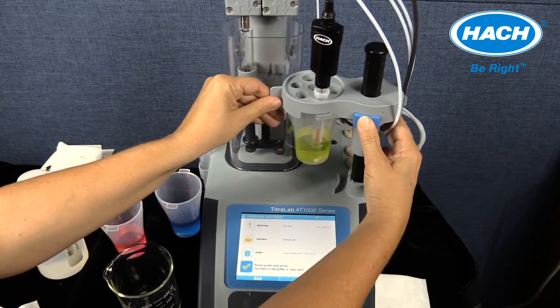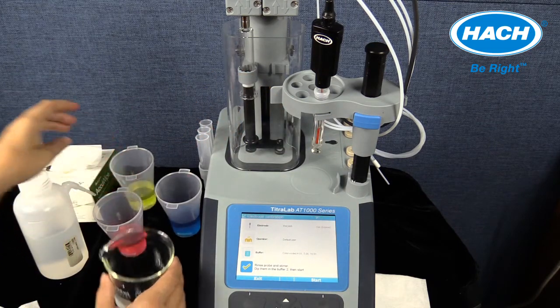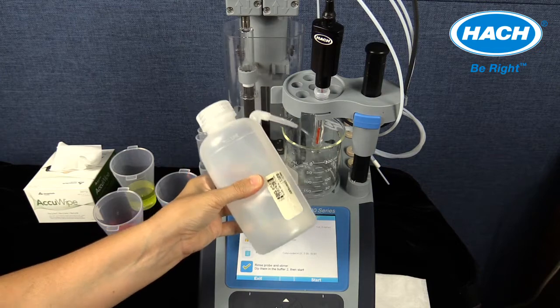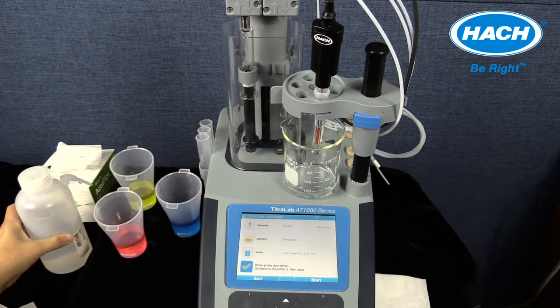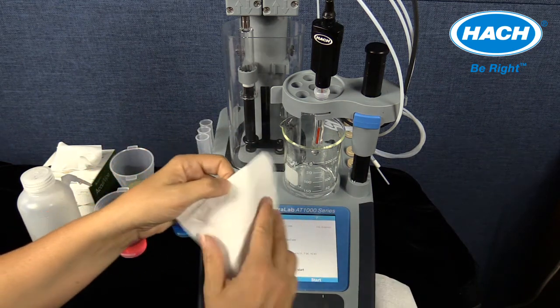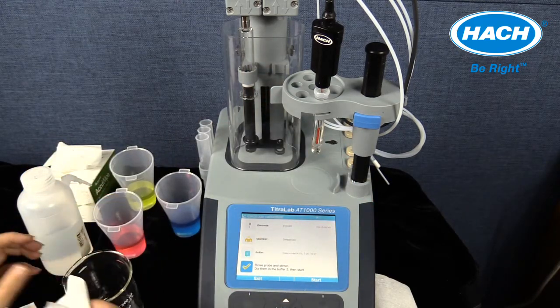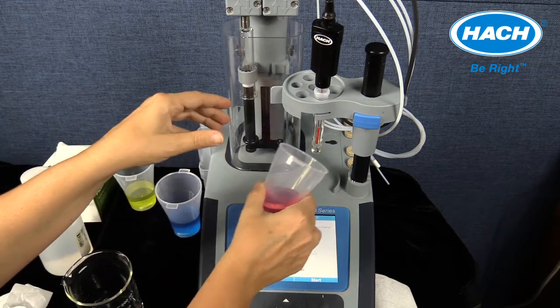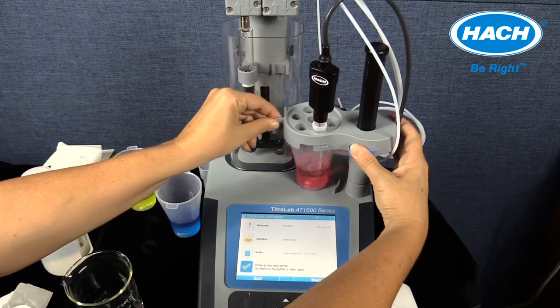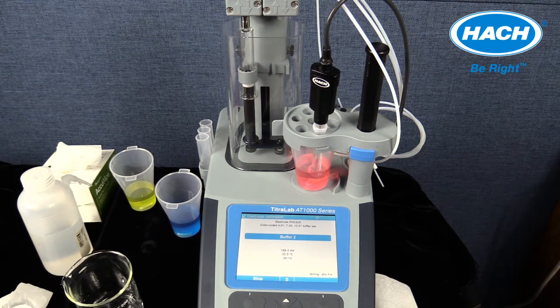Slide the sensor holder up, remove the first sample beaker, rinse the probe with deionized water into the waste container, and blot the electrode dry with a clean wipe. Then replace and lock the second beaker containing the second buffer solution and stir bar into place. Then lower the sensor holder and insert the electrode into the sensor holder. Start analysis of the second buffer by selecting Start.